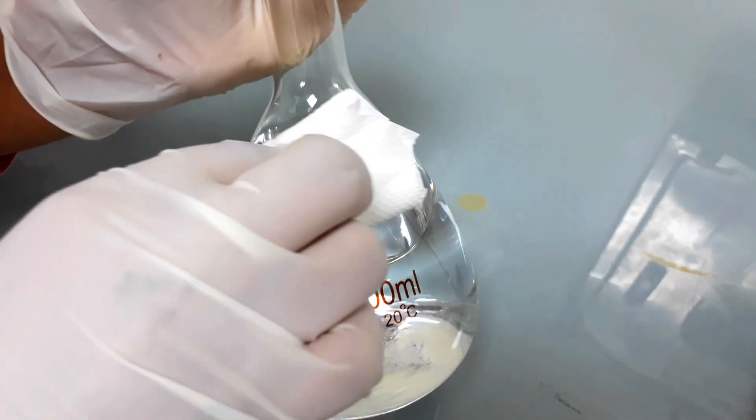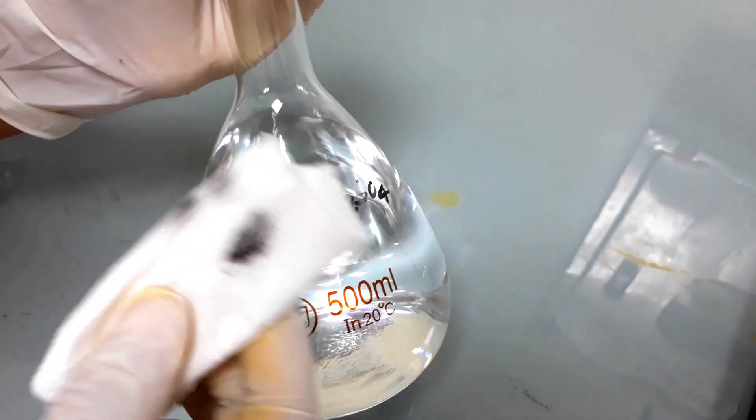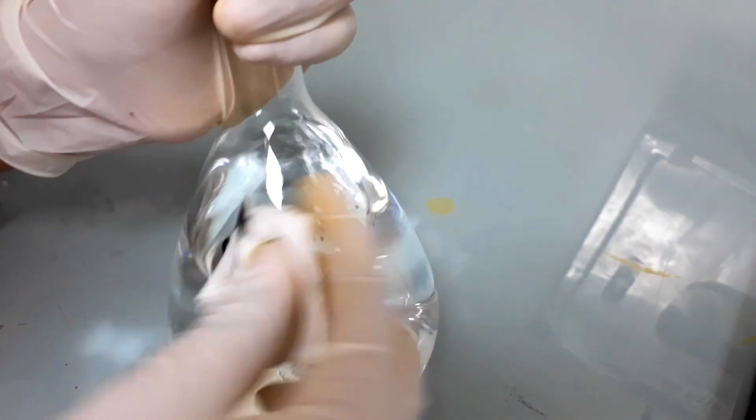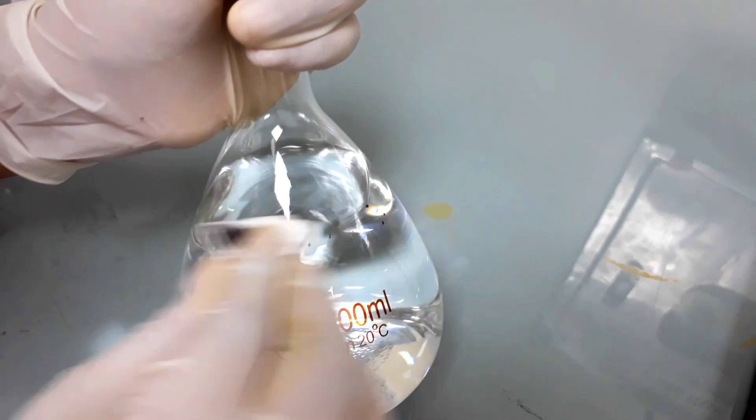Let's correct the label of the flask containing sulfuric acid solution.